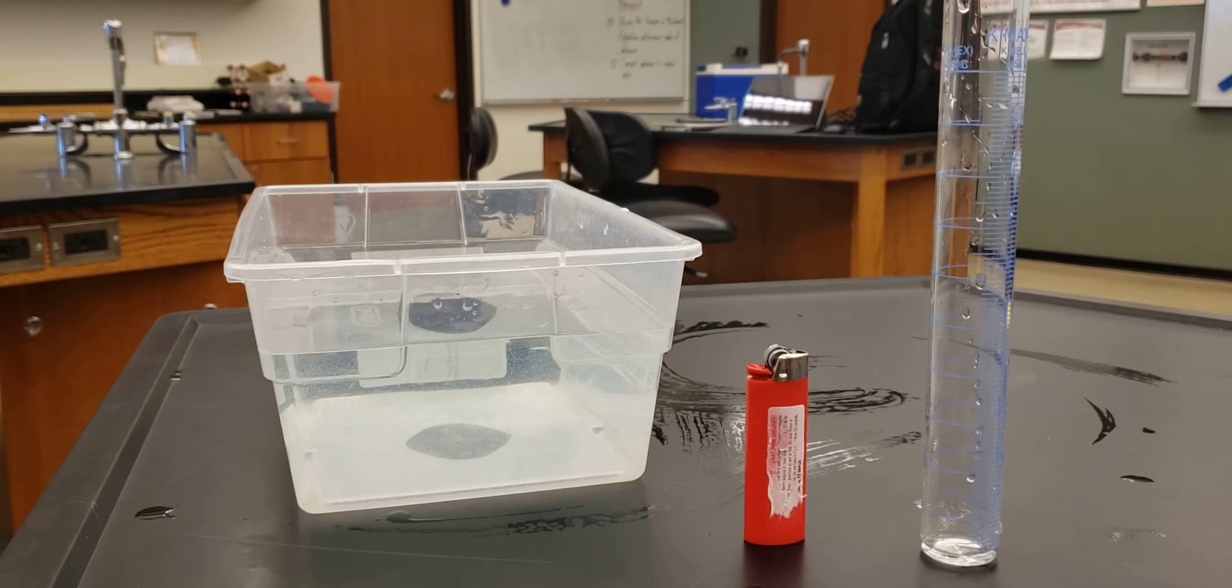Now I've taken the bottom off it, and you'll see why in a second. We also need a tank of water and a thermometer so that we can get the temperature for the tank of water.